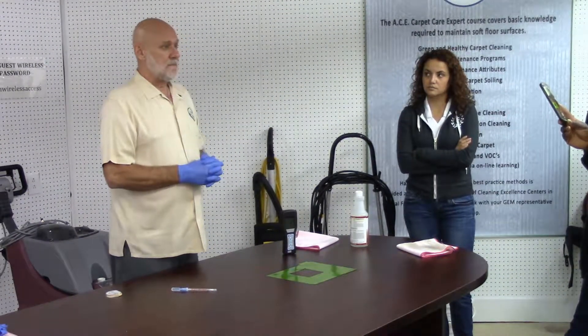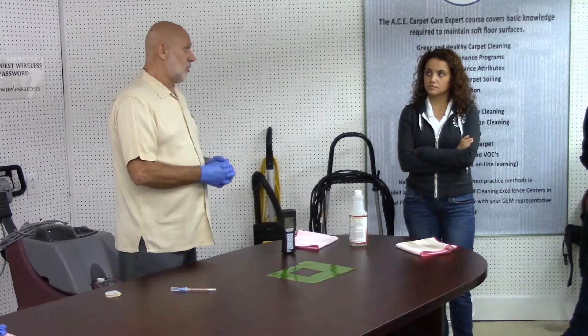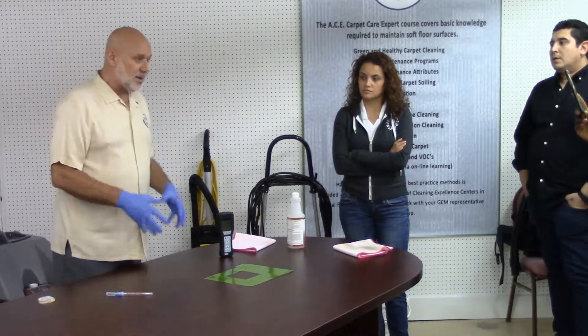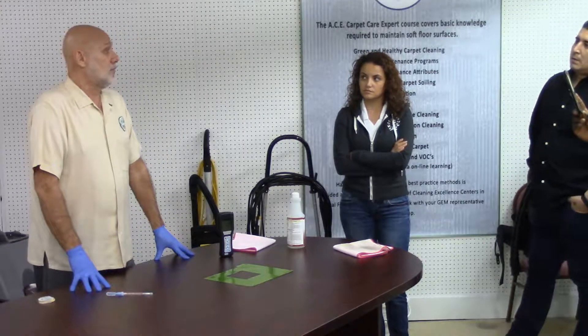What does it say? 29. 30 is considered dirty by this metering device if I'm preparing food. This is a table where we had food — we did not prepare it, it was already prepared — but you had a cold cut sandwich. Had that cold cut sandwich come in contact with this surface, would that have been appropriate for me to consume?